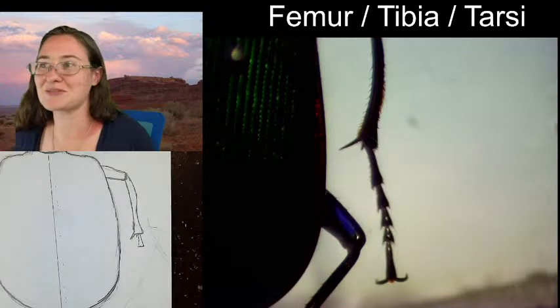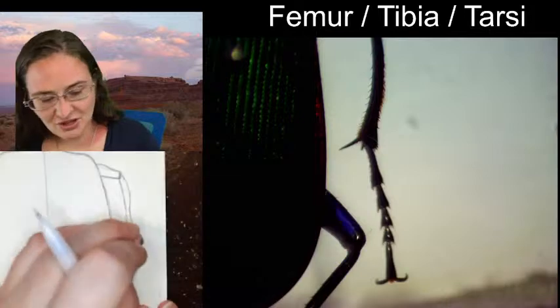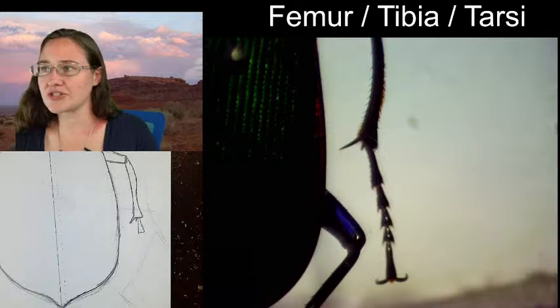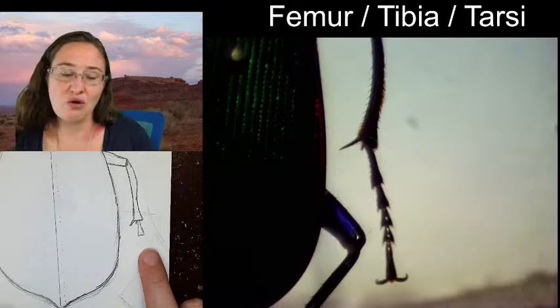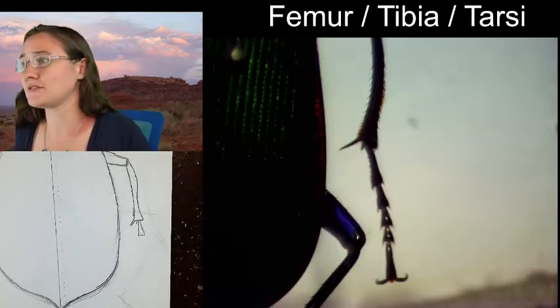Didn't let it focus before I froze it. There we go. Alright, so it's kind of even longer than this. Wow. Nice long tarsal segments. These longer tarsal segments and very, very long legs, I imagine, and these beetles are very fast. So I would call these cursorial legs.